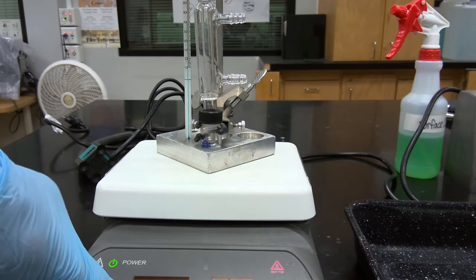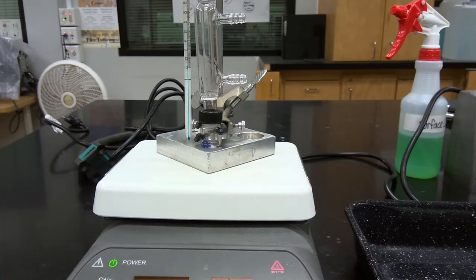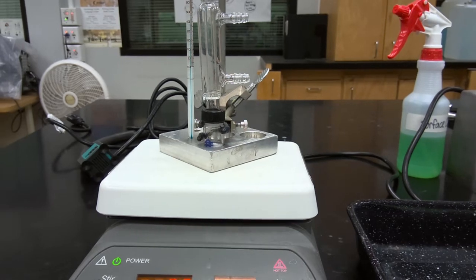The heating bath and the heating block takes a fairly long time to reach the target temperature, so I'm just showing you the completed assembled setup, and then I'm going to add the circulating water condenser. So we'll resume once we've reached the target temperature and we can begin timing the reaction.